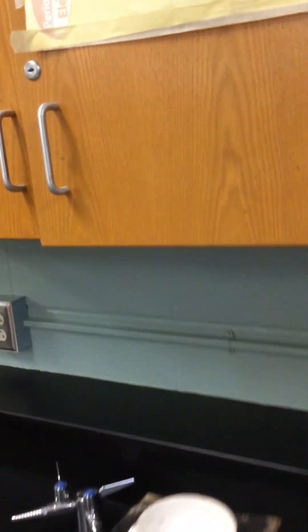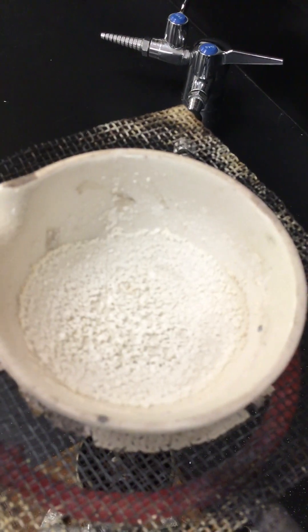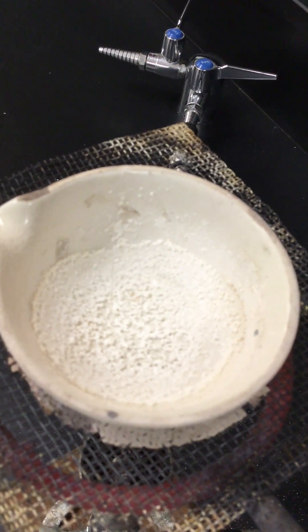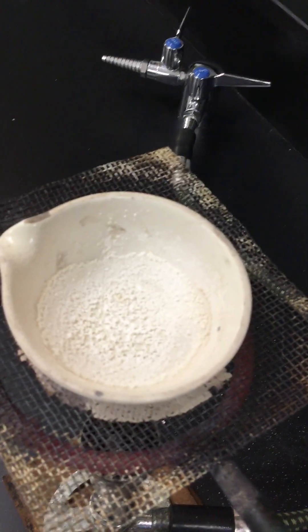And I'm going to bring this up here. I'm going to show you the inside of our evaporating dish. Oh my gosh, what the heck could that be?